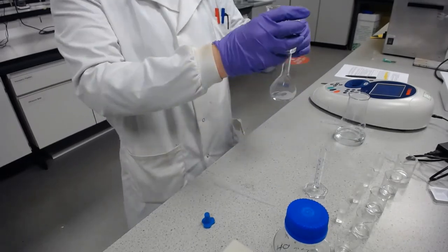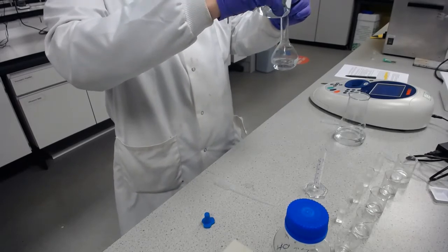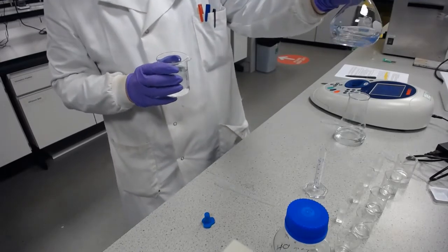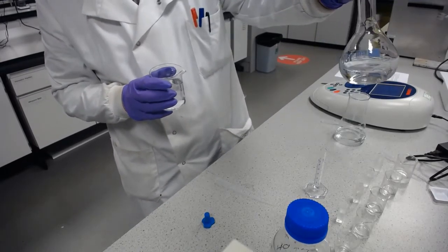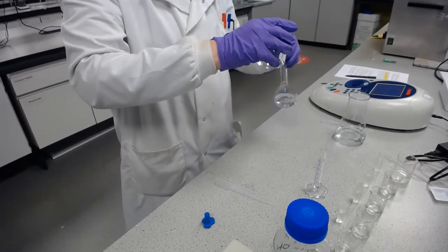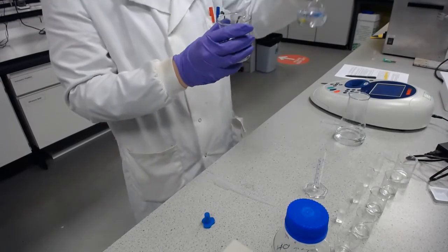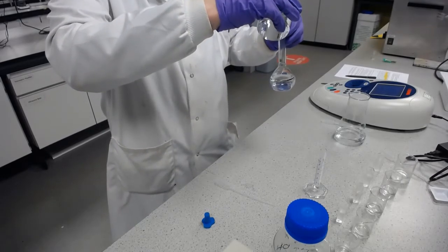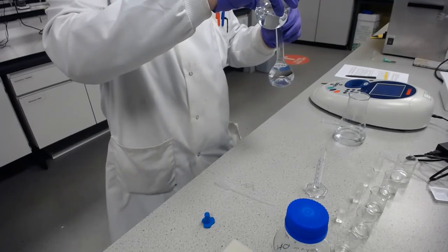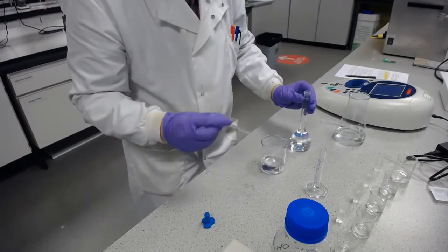So this is the 0.1 molar sodium hydroxide. Now at this stage, if you're not 100% sure, it's still worth checking that you've got the right phase, because we're in glass, and you can see that I haven't got two phases, I've got one phase. It's mixing, so it's definitely the aqueous phase. It's always worth doing these checks, because the next stage is it's going to go into the plastic cuvette, and it would be worse if it were to get through the plastic cuvette and cause damage to the spectrophotometer.